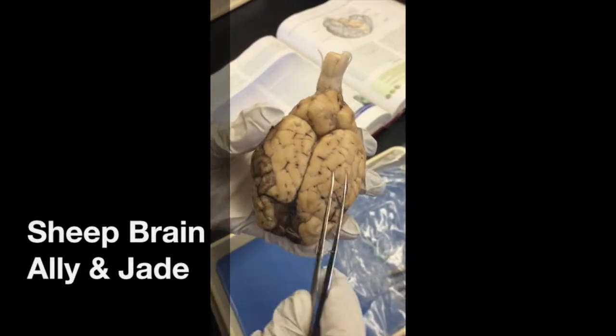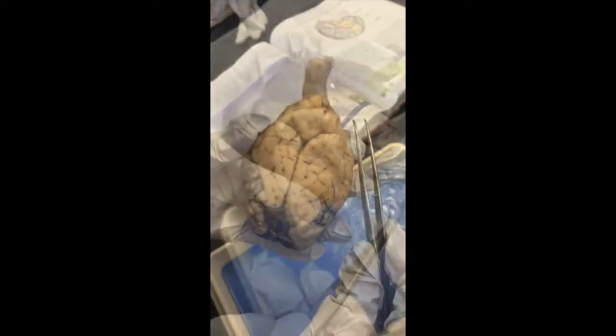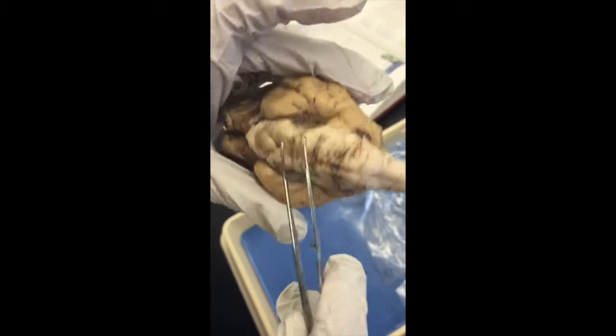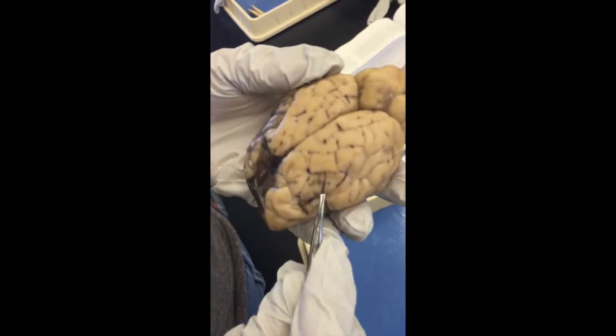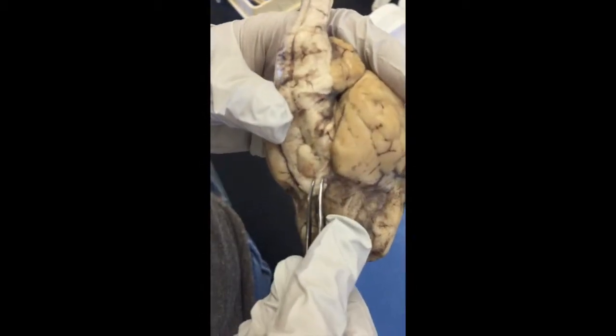These two parts of the cerebrum. This is the cerebellum. Most of the dura mater is already removed. It's the thick, opaque surface on this, but most of it's already removed. Okay. The pia mater is the brown stuff, and it's also the thin connective tissue that you can pull off.